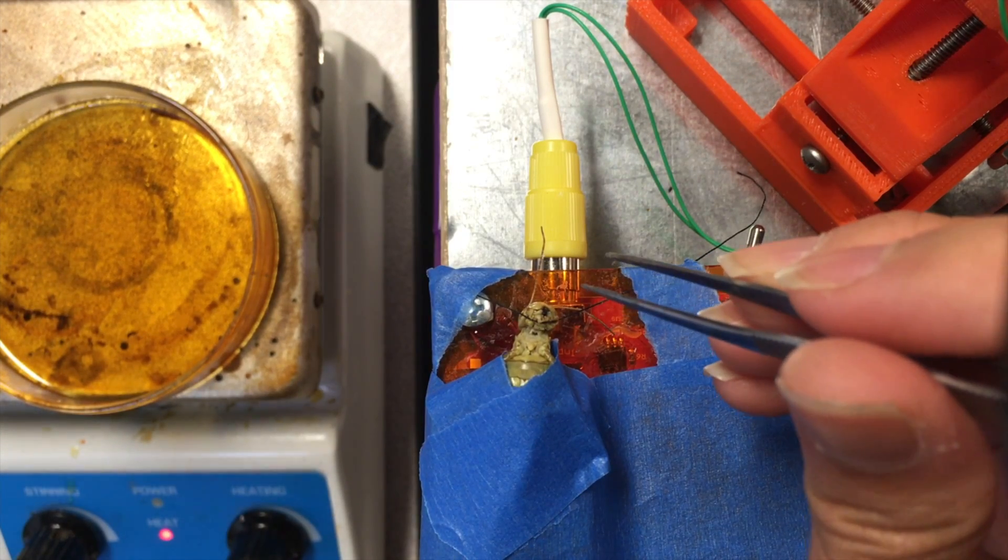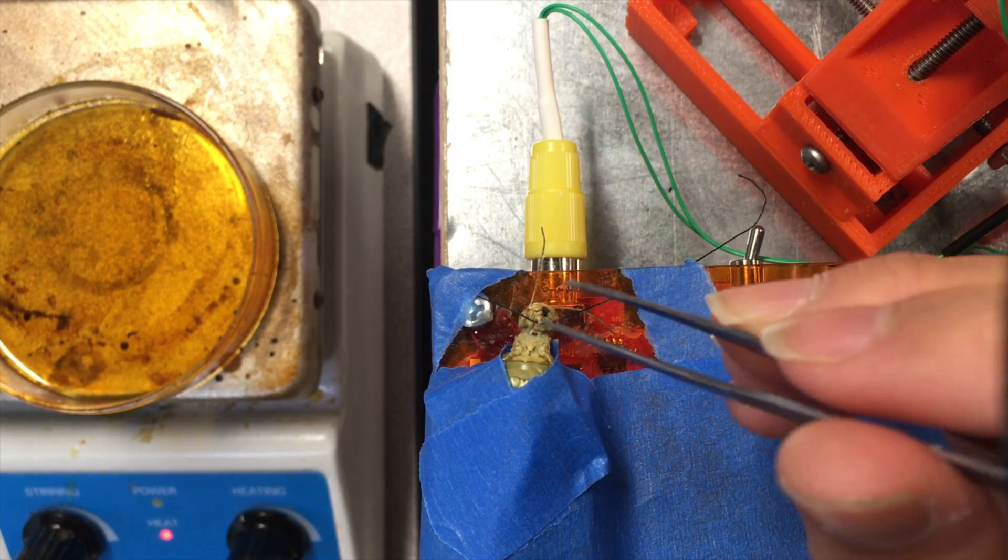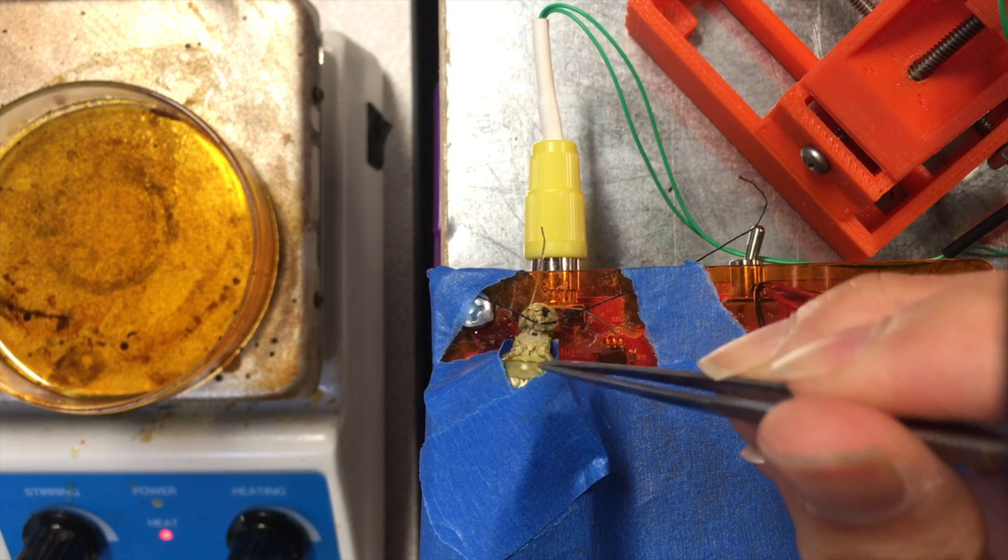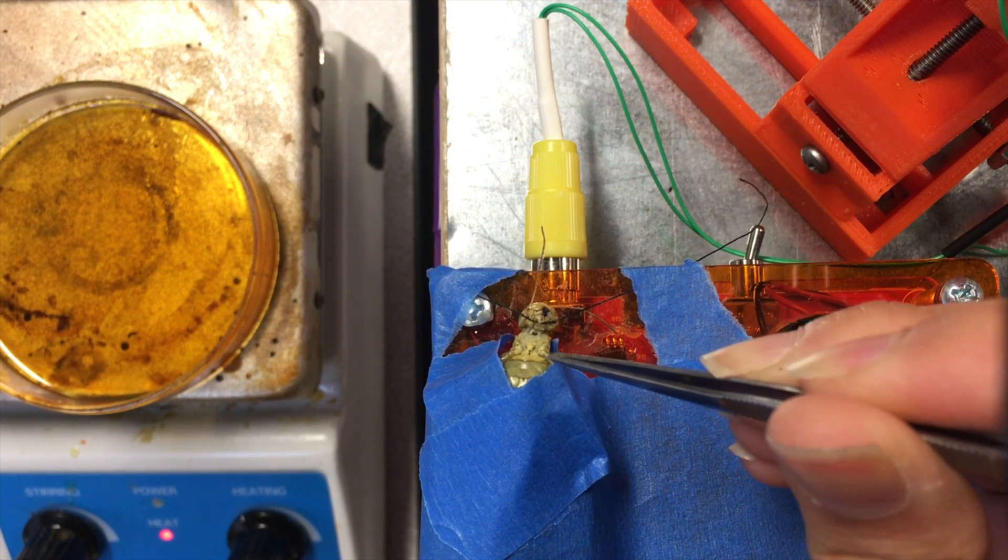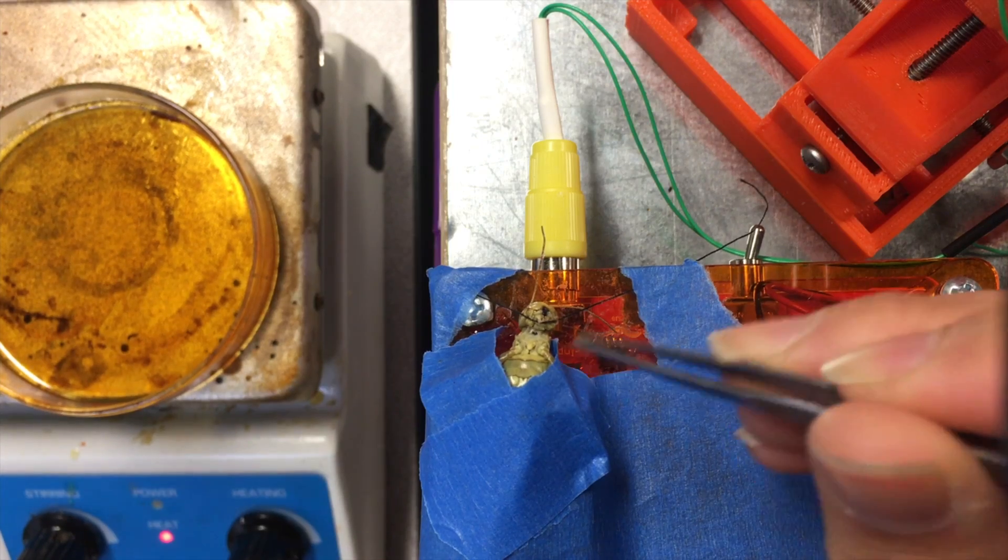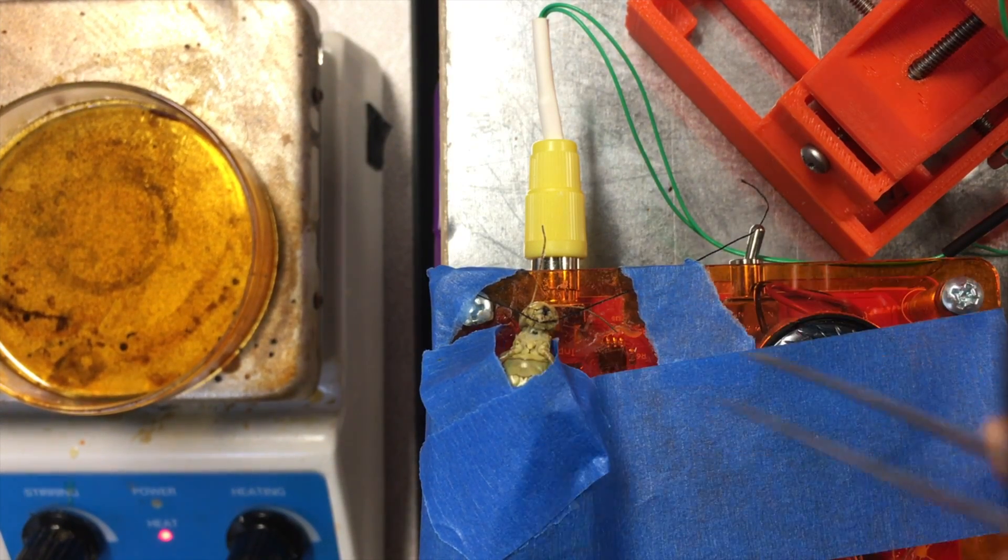I'm using a thread to pull the head back because I will place a recording electrode into the neck of the grasshopper where the axon of the DCMD is, and we can record its activity there using the spiker box amplifier.